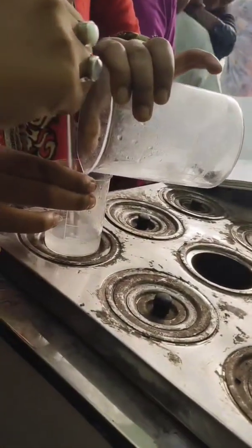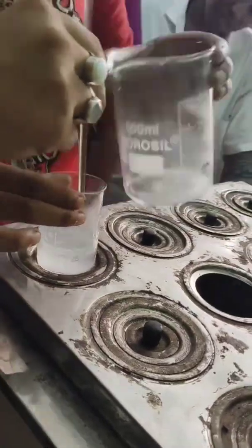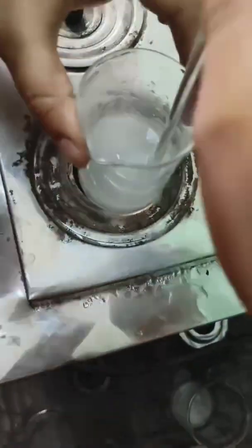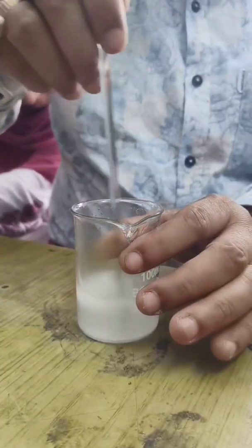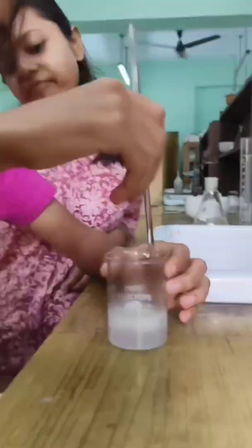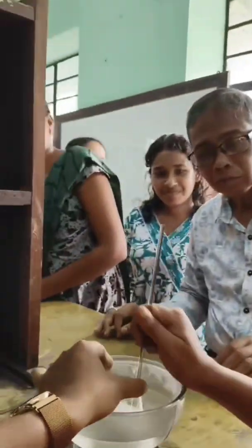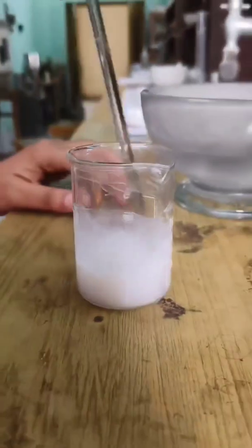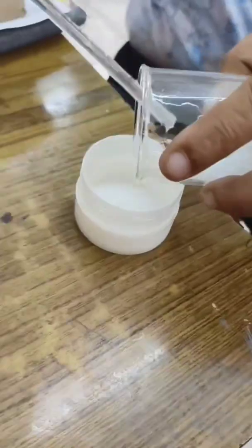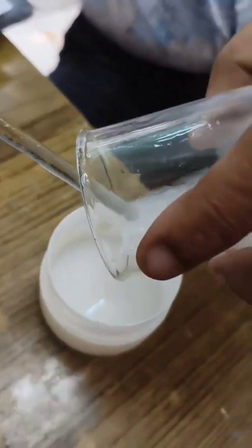Step 2. Simultaneously, we prepare the aqueous phase by dissolving cetrimide in purified water and heating it to the same temperature. The hot aqueous phase is then slowly added to the hot oil phase with continuous stirring to form a smooth emulsion.